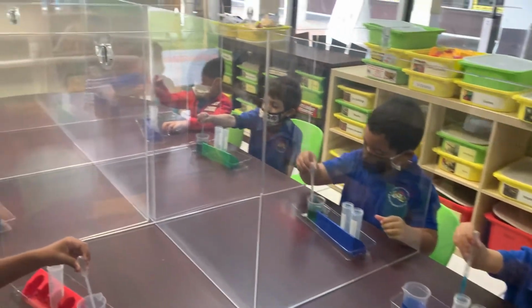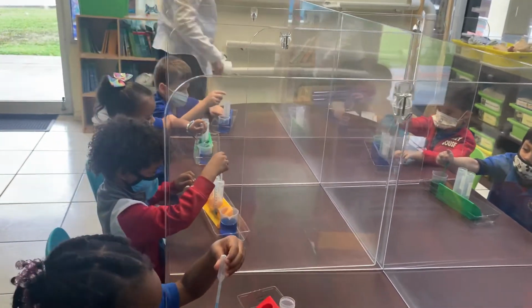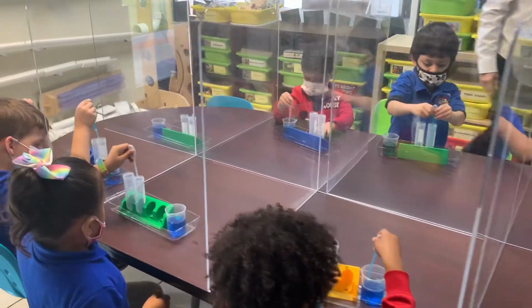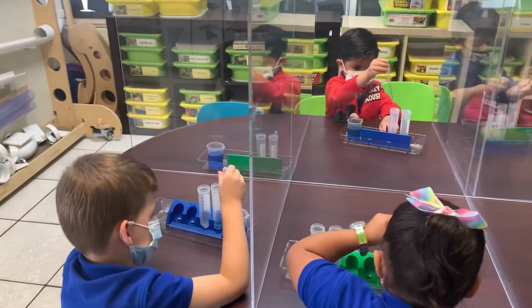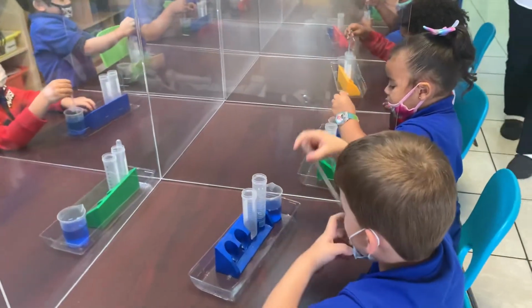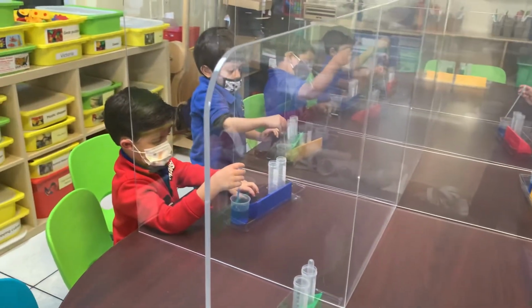I went to 5. Oh, but you want to go to 35. So keep going until you get to the 35. 35 is right here. Good. Keep going till you get to the 35. The 3 and the 5. I'm almost done. I'm at 10. Oh, he's at 10. Good. Okay, leave your test tube in the rack. It's easier that way.